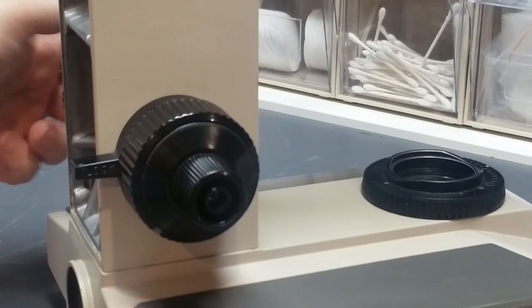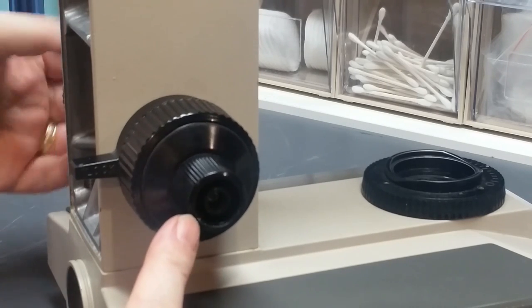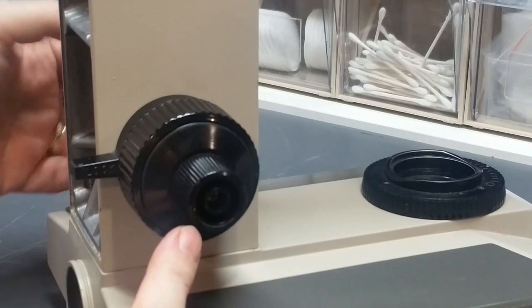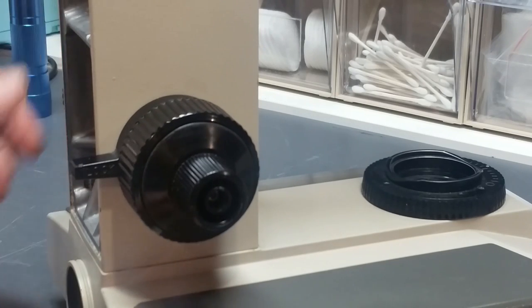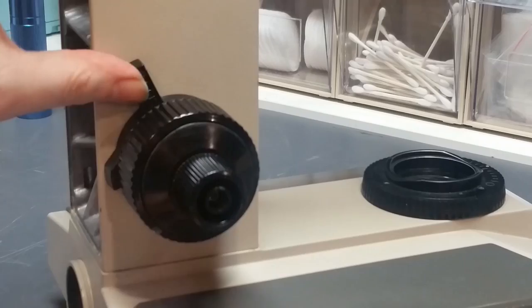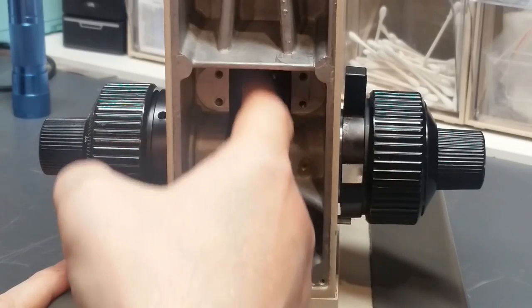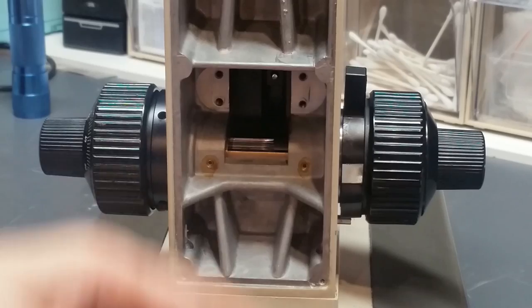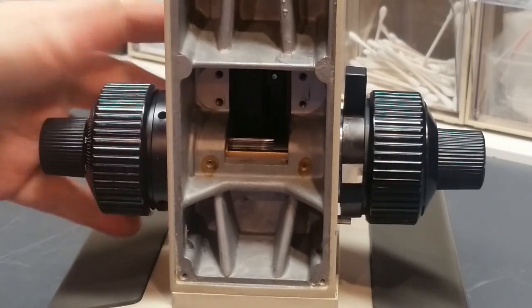And if you look, you'll see that the thing is turning. Everything's decent. I've got just a touch of wobble in this knob. I had a lot more wobble than that originally, but I did a little barbarian work with a mallet, and I got that shaft pretty darn straight, so I'm totally happy with that. So, that takes care of the coaxial focus. The knobs are in place. All that remains to be done is to put the brass focus rack in here, clean, reinstall the gearbox, put the cover on, put the knob caps on, and we'll basically be done with this part of the mechanism.